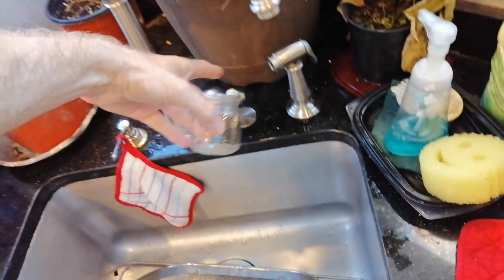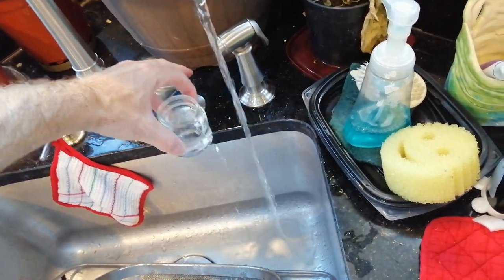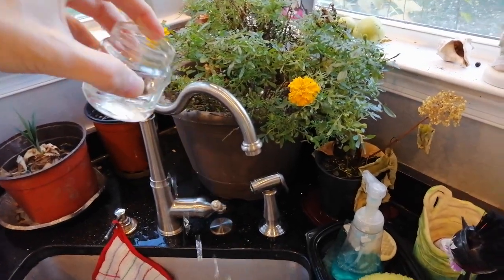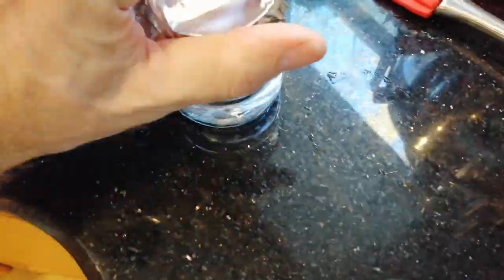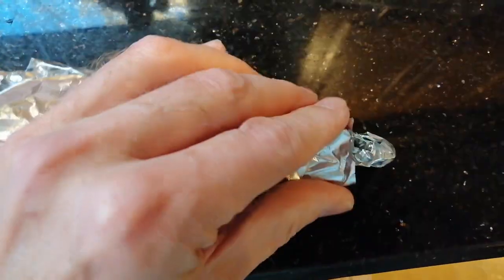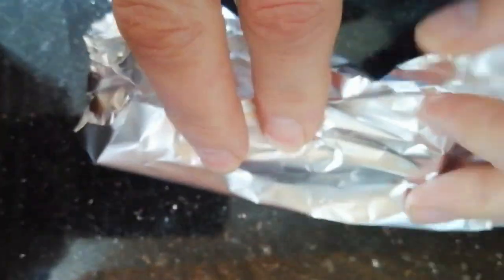We need a small jar of water which will be used for creating the spore syringe. I'm just going to directly use this small jar without any water transfers — you can see it's a little less than halfway full. Put some foil over the top of your water jar and then add it to your pressure cooker. You will need a knife or razor for scraping the spores, so add that to your pressure cooker as well — you can wrap them in foil. If your syringe was not sterile, including one you've already used, just clean it off well with water, separate all the components, wrap it all in foil, and add that to your pressure cooker.